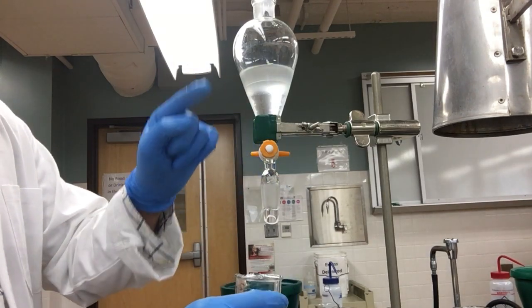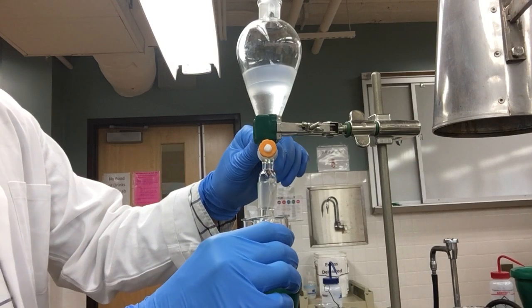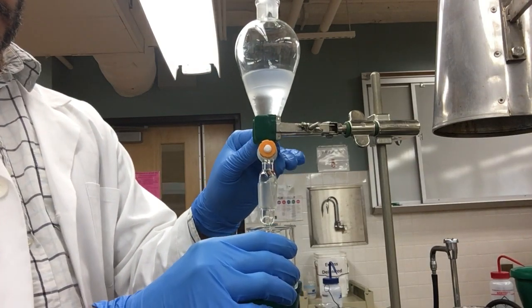Now that the two layers have separated, we will remove the bottom layer by opening the stopcock, which is our aqueous layer.